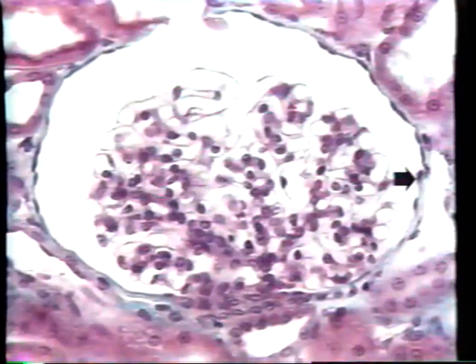The first kind of epithelium we're going to look at is simple squamous epithelium, and that consists of a single layer of flat cells. This image right here is a section through the Bowman's capsule of the nephron of the kidney, and it's lined by an epithelium, which is indicated by the arrow, which is a simple squamous epithelium. The epithelium here is extremely thin, extremely flat, and what you can see are these little purple bulges. Each of these represents the nucleus of a single cell. So there's a nucleus here, and then a string of cytoplasm here, and a nucleus here.